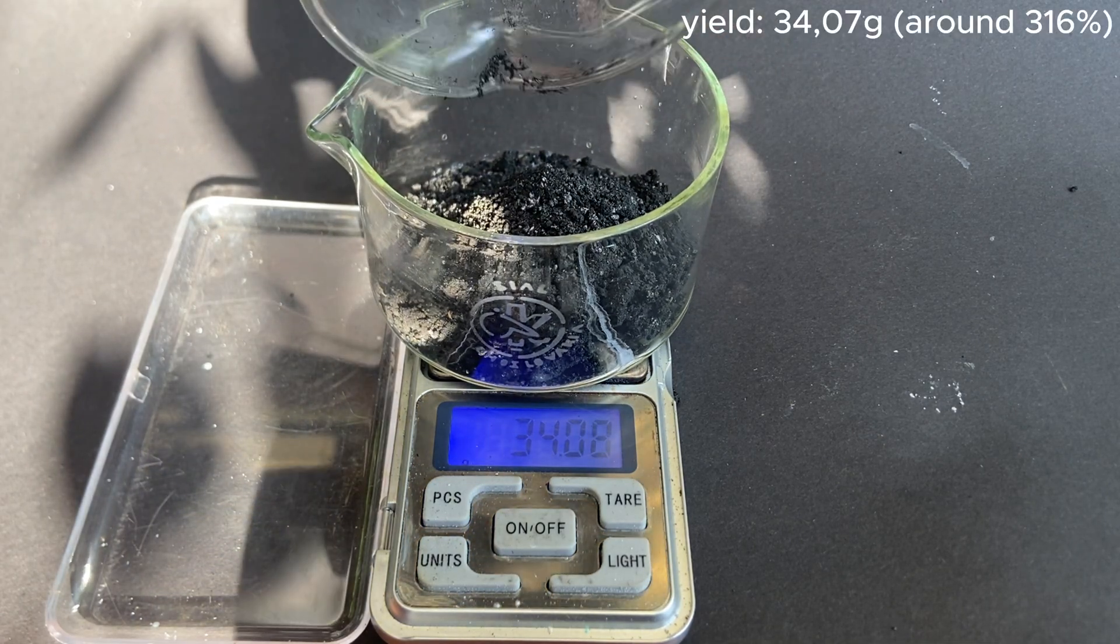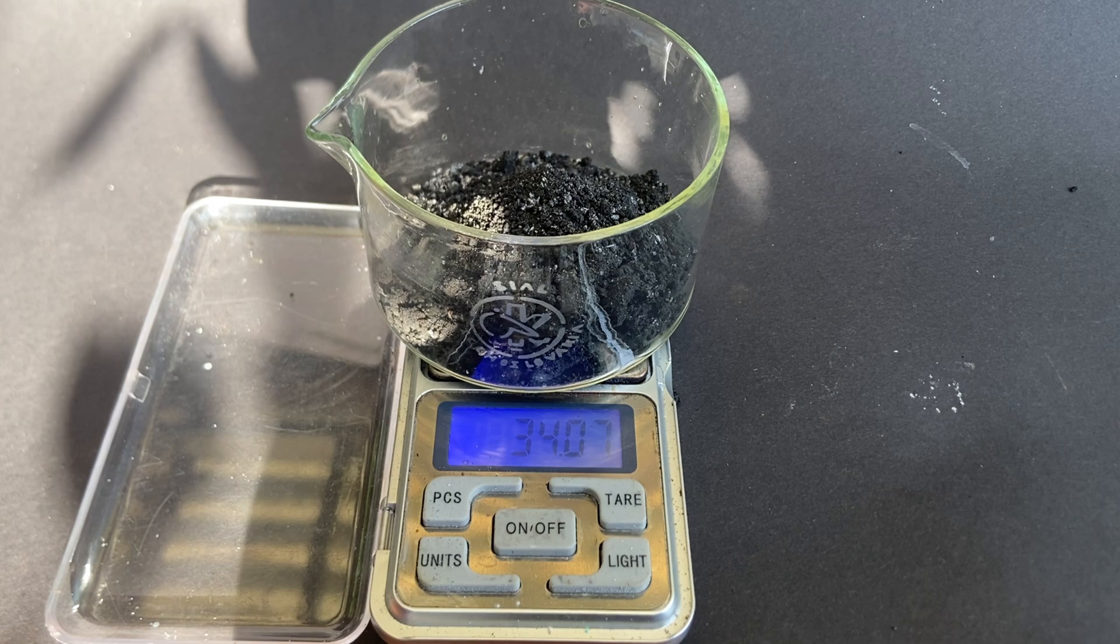which came around 34g, which would represent 316% yield, which means that it's still mostly slag. I however have no idea how to clean it better so I will have to leave it like this.